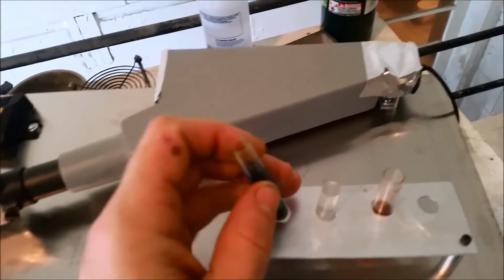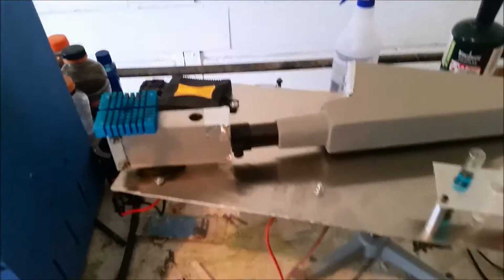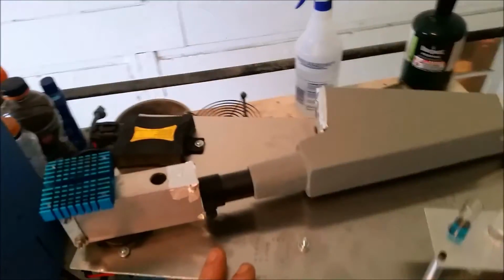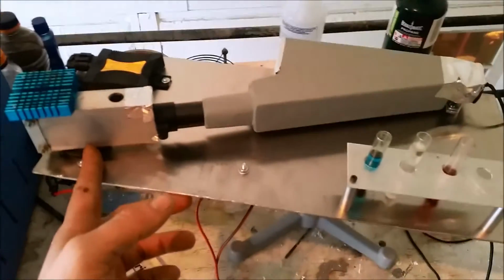Now I did run into a problem. The light bulb that I bought that I thought was a xenon bulb is not a xenon bulb, or if it is, it's a mercury xenon bulb. When I fired this thing up, I was trying to get it calibrated to a xenon bulb, and I had nothing but issues. After doing a lot of research, it turns out that the spectra that comes from this bulb is a mercury bulb.